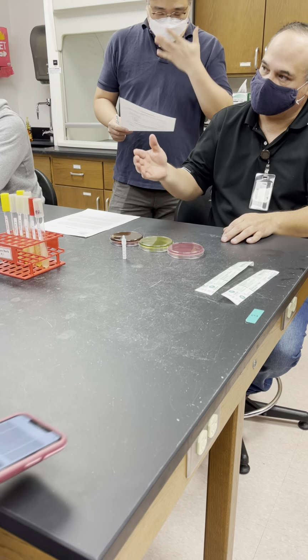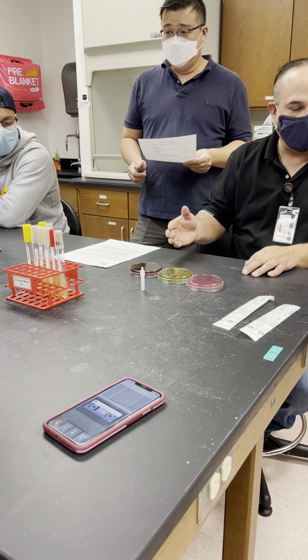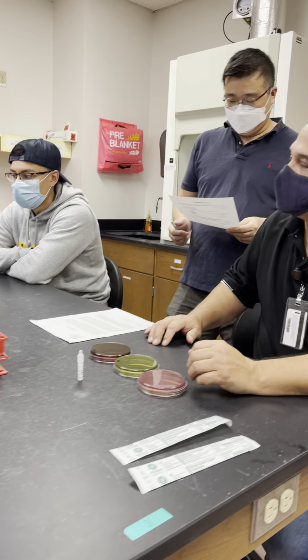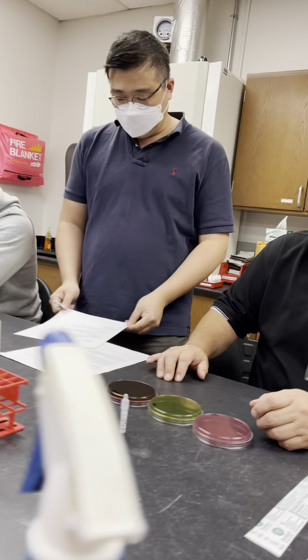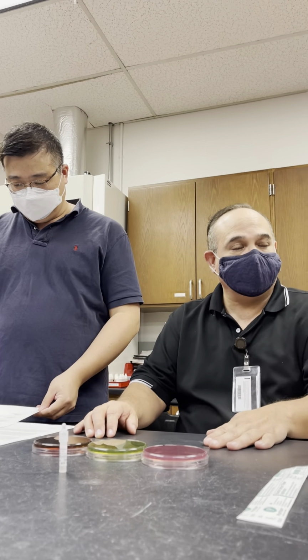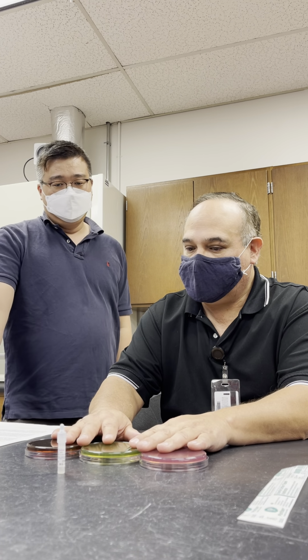An enteric organism is a gram-negative bacillus. It's oxidase negative. It is a glucose fermenter. It reduces nitrate to nitrite. And if it's motile, it has peritrichous flagella. That's the definition, right? So these media are used for different applications.